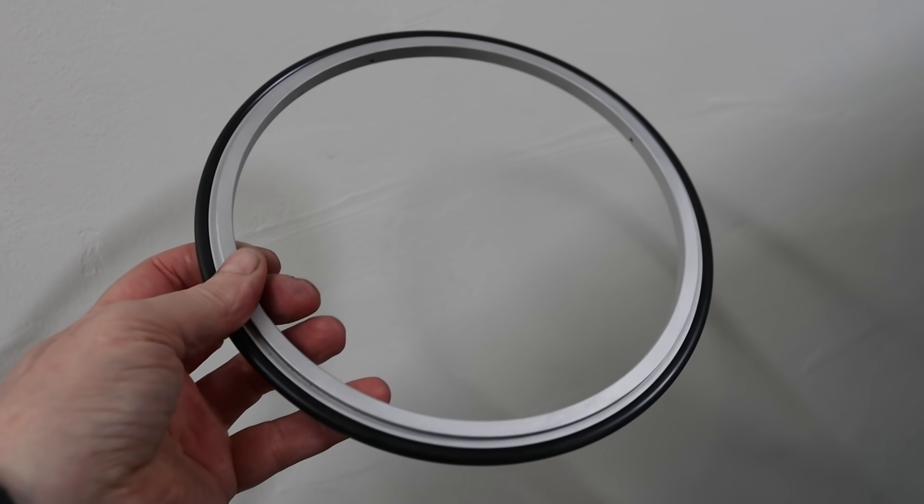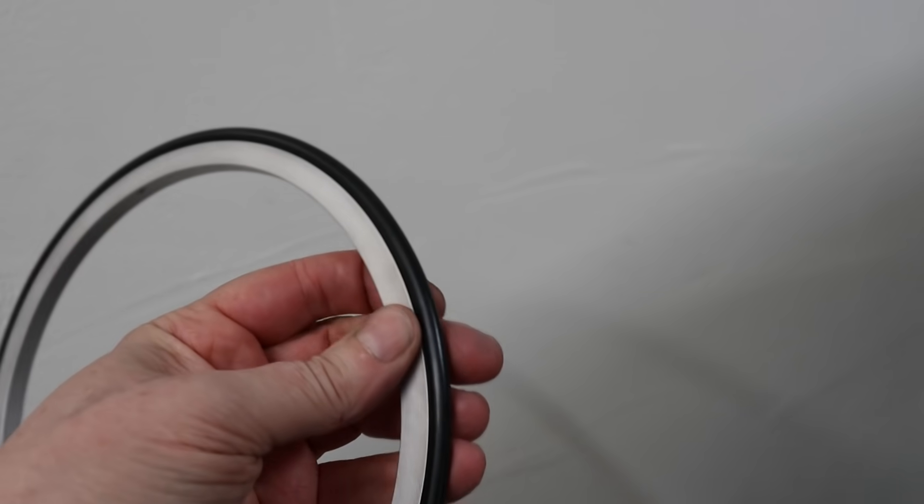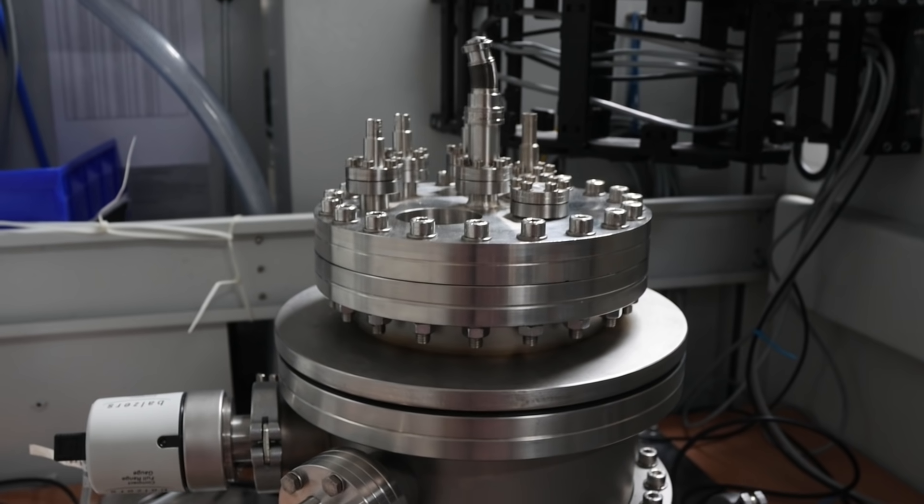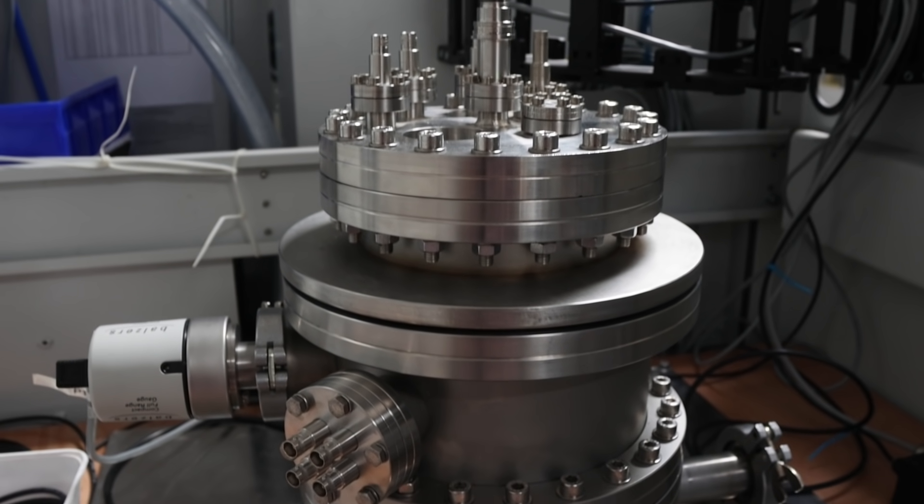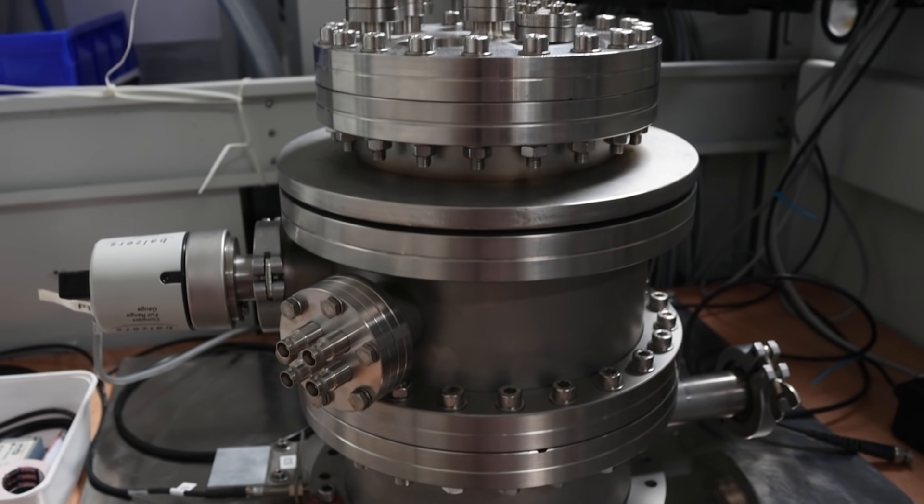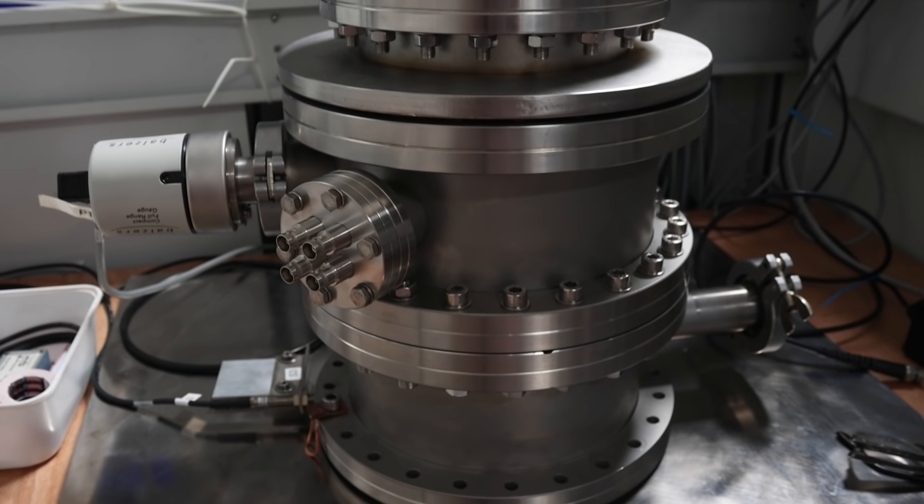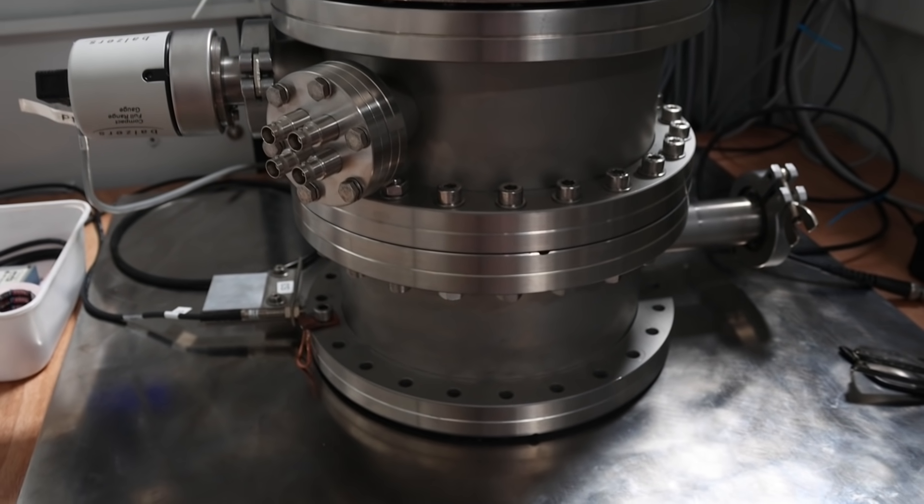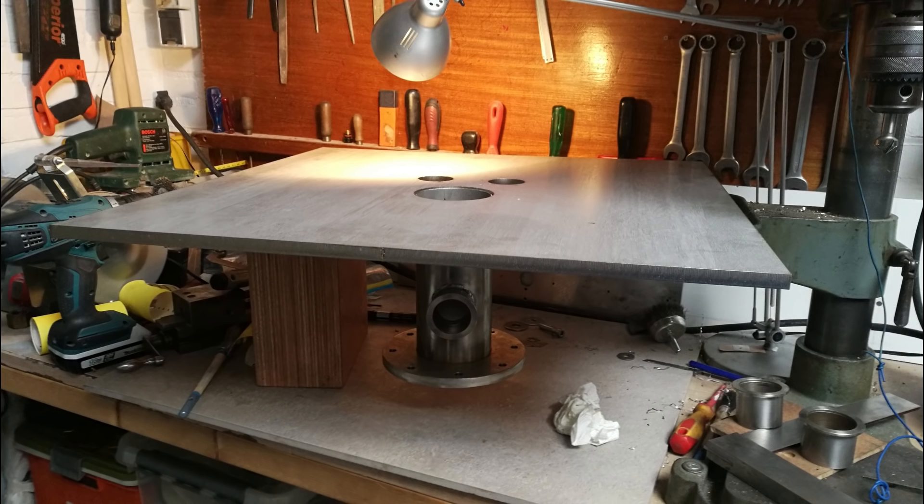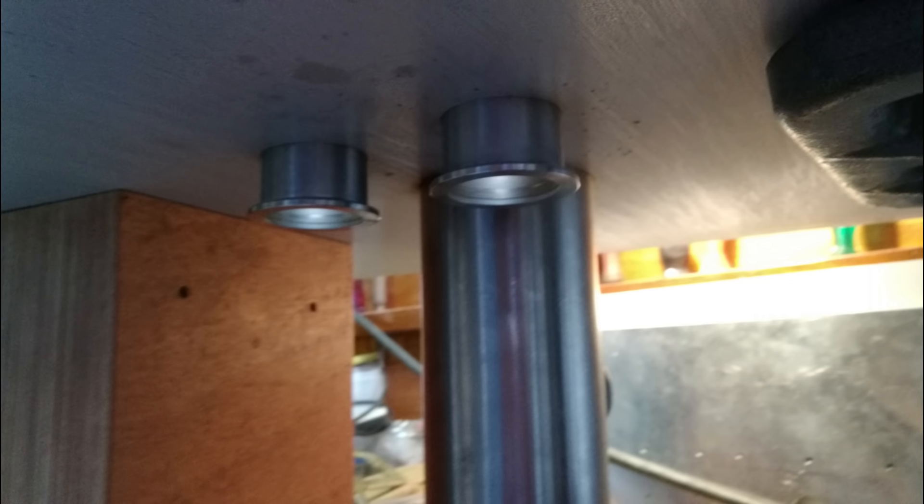The parts can then be stacked together by using some homemade large vacuum rings. The chamber cylinder and the lid are basically adaptations of some surplus parts. But the bottom plate is something that I designed specifically for this system. It is made of 12mm thick stainless steel plate, in which I had some holes made and to which I added a few vacuum connections using TIG welding.